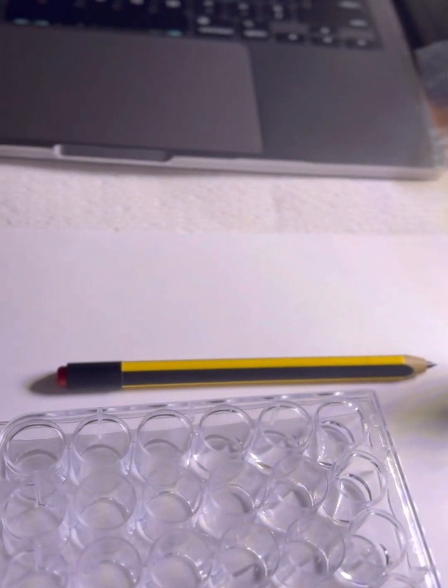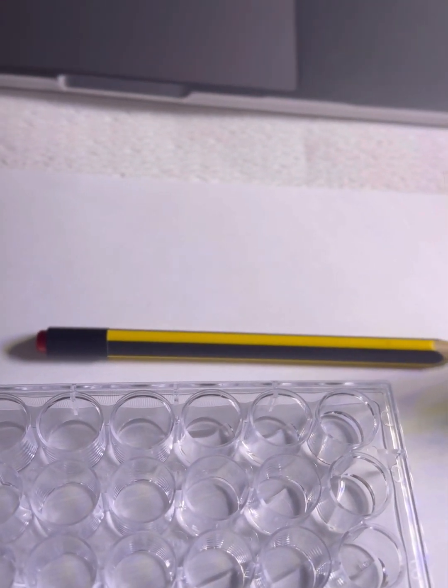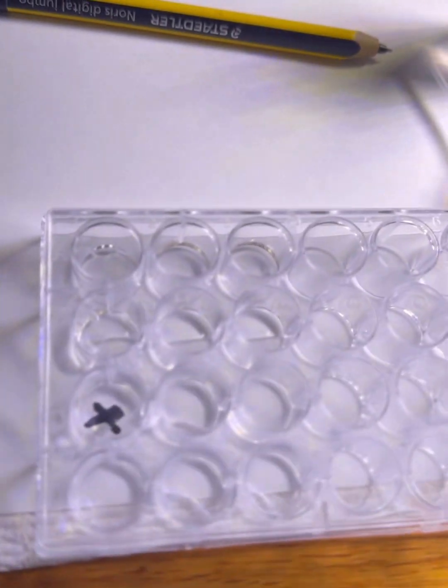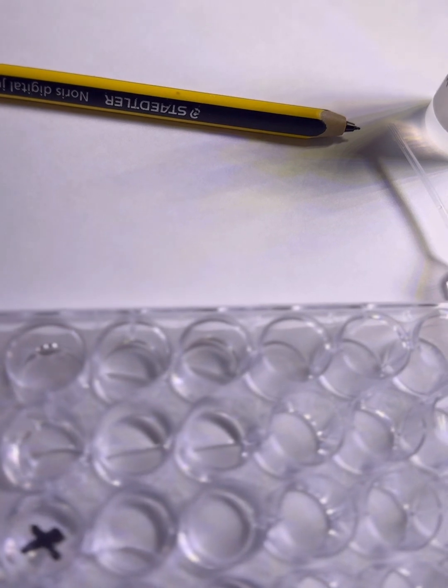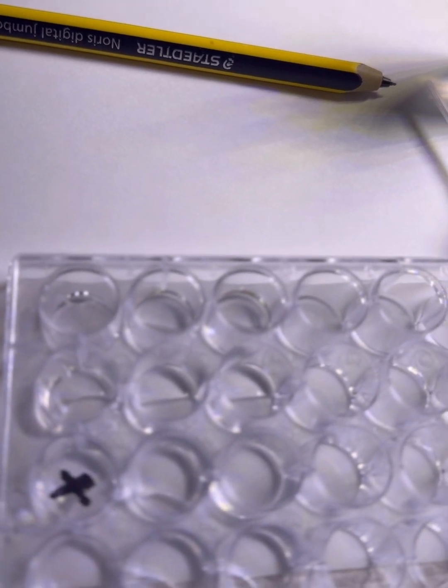So make sure to get all of it out. So I've gotten out from A1 some Na2S2O3. And the next step says to, alright, so we set the C1 back over the X like this. And it says to take a pipette of Na2S2O3 and squeeze all the contents of the bulb into this well C1 and immediately begin timing.